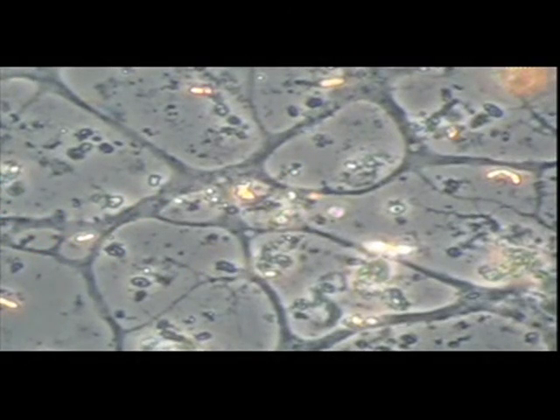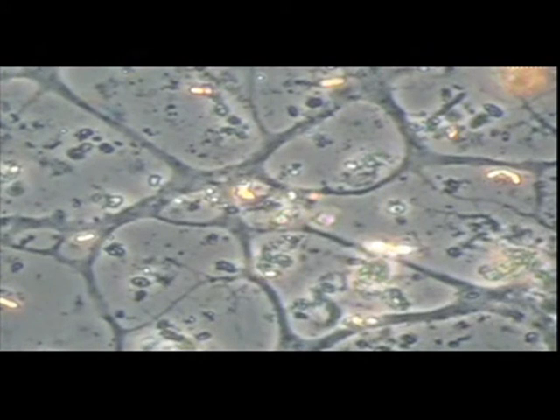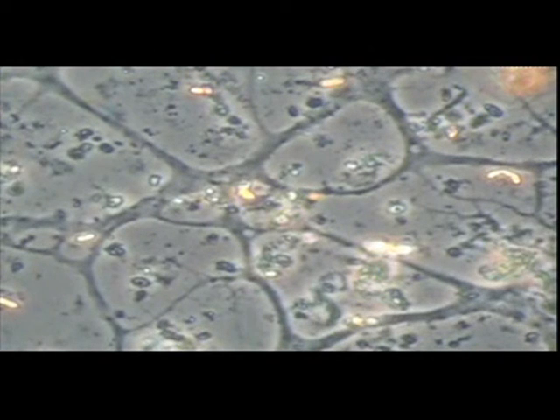This is a giant amoeba, Arachnula impatiens. It can reach up to 1 millimeter in diameter. It has many nuclei and many contractile vacuoles. This amoeba can produce large quantities of mucilage that can trap suitable prey for subsequent engulfment by the fine pseudopodia. It belongs to the family Vampyrellidae. It can cut holes in many fungal spores and remove the cell contents, so it is aptly named. It is also known to attack plant pathogenic nematodes, but it is not known if these amoebae can control nematode or fungal populations in the soil.